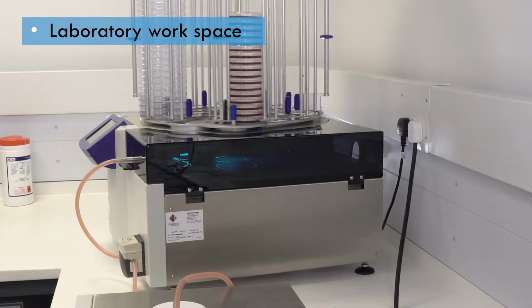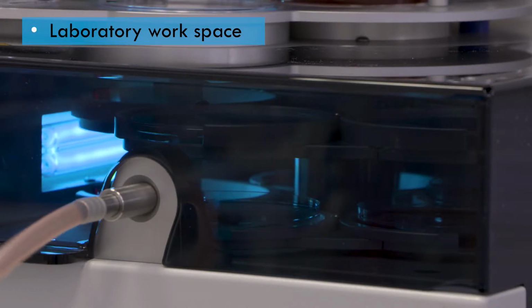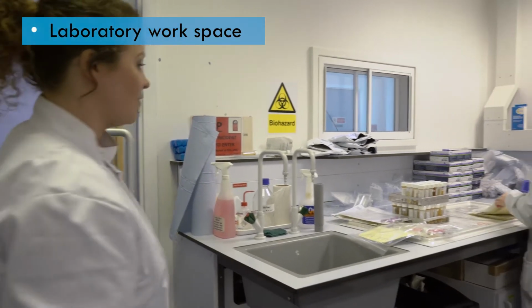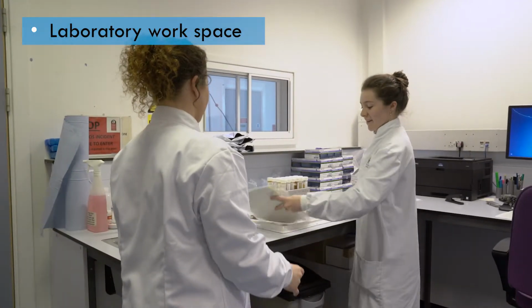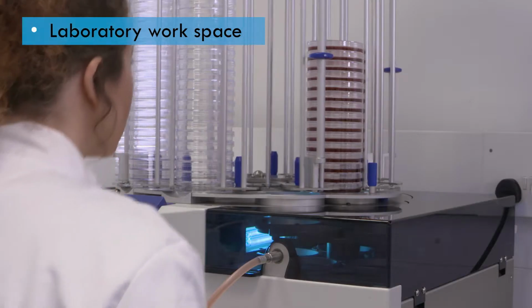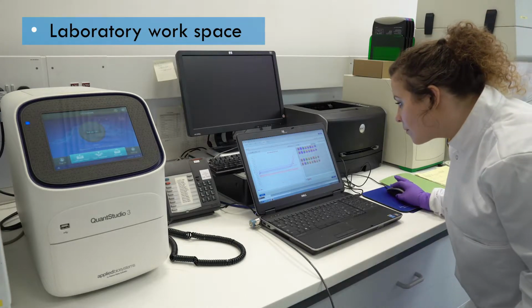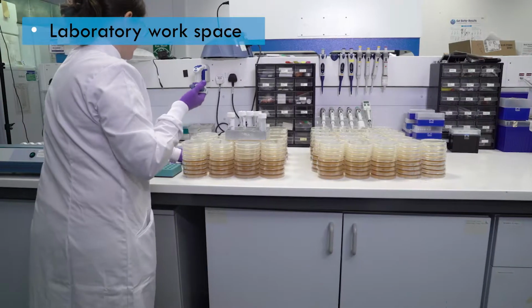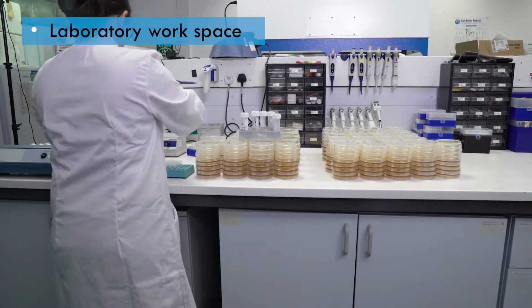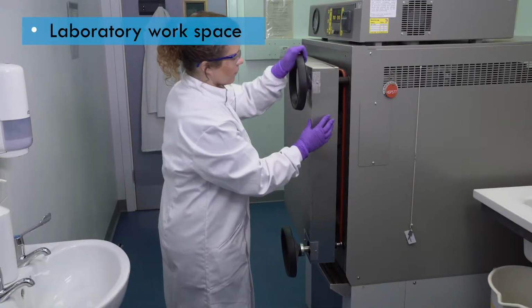There are some activities that should ideally be carried out in separate laboratories or rooms. Examples include primary sample collection, media and some reagent preparation, molecular techniques such as PCR, cultivation of biological agents, and autoclaving.